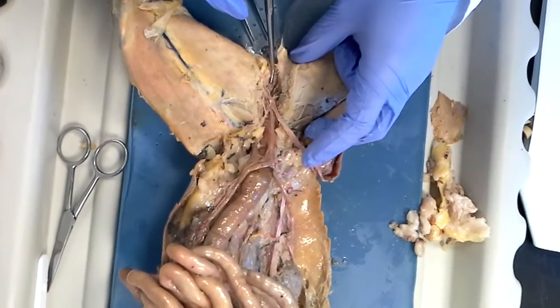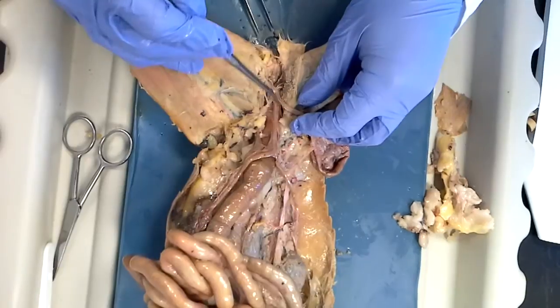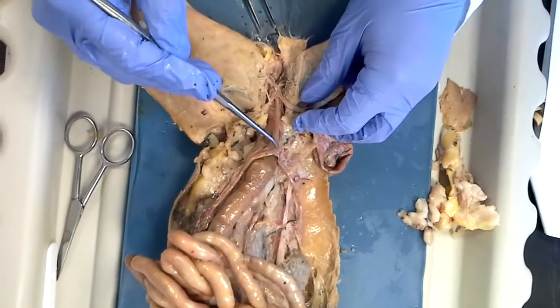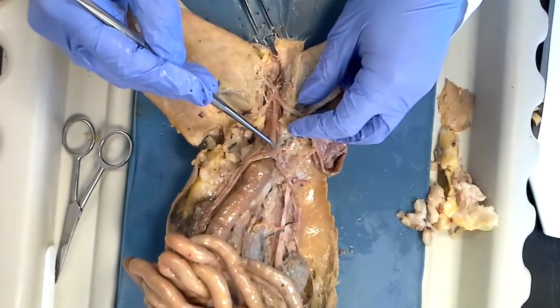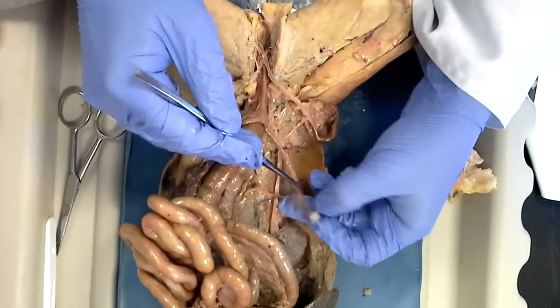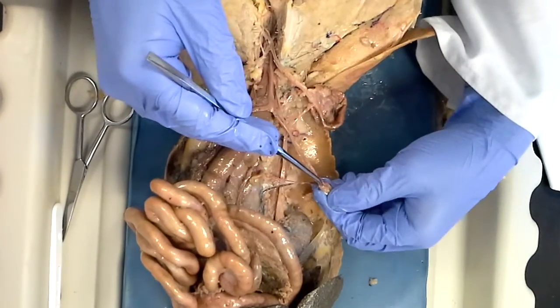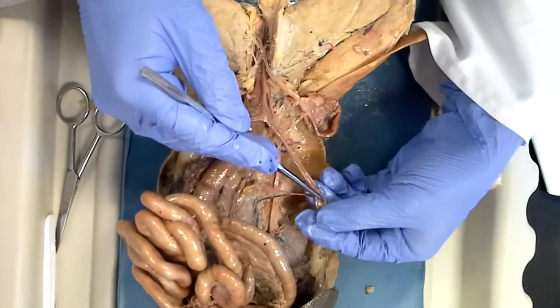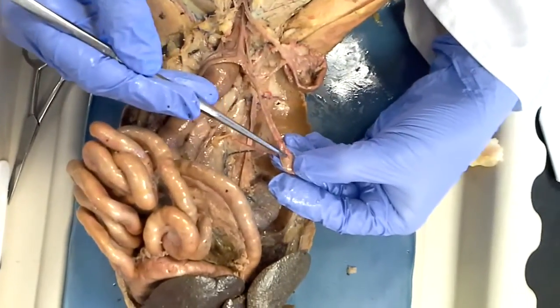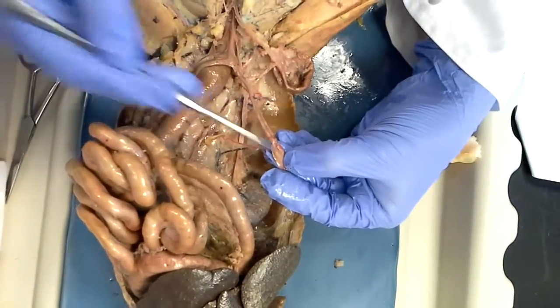So if we follow the female reproductive tract upward, we start with the urogenital sinus, then we get to this tube here, the vagina, which leads us to the uterus, then the uterine horns, then the oviducts — those tubes — and then the ovary.